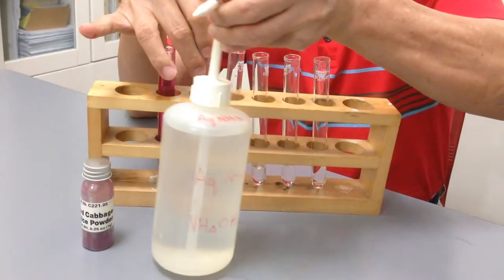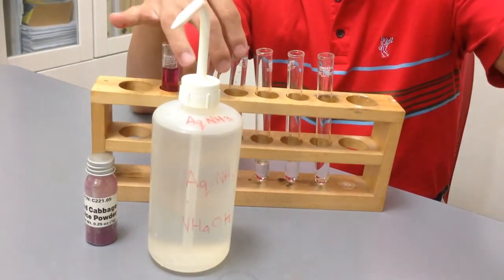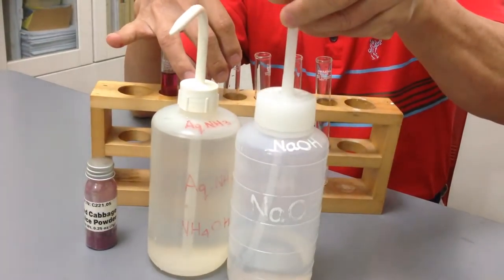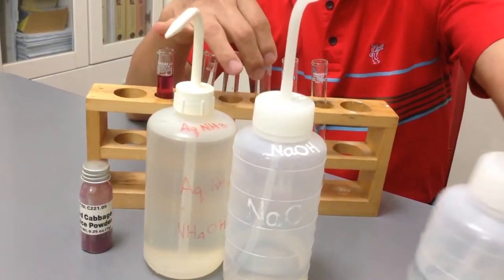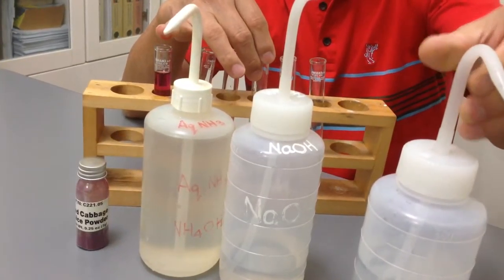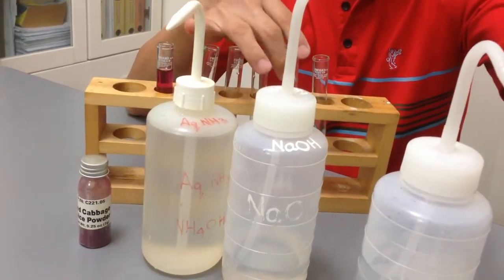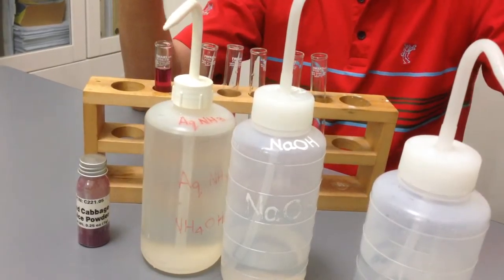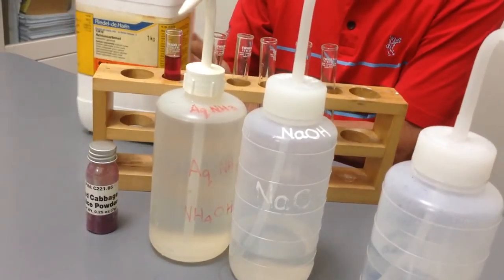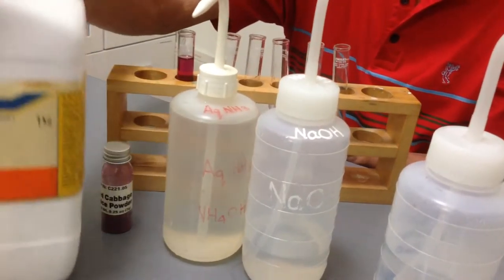First is sodium, ammonium hydroxide. Then this is sodium hydroxide. This one, the middle one is water, and this is hydrochloric acid. Oh, the first one is sodium carbonate. The first one is sodium carbonate.